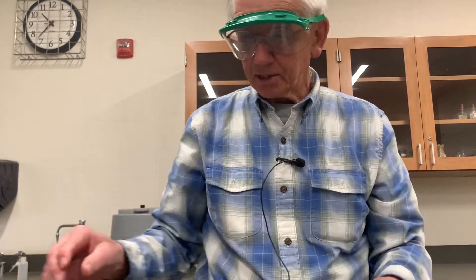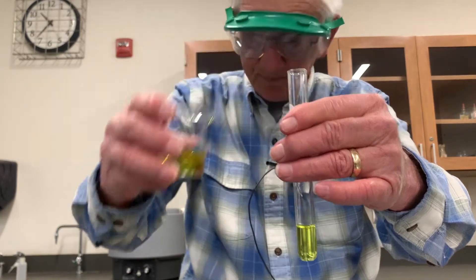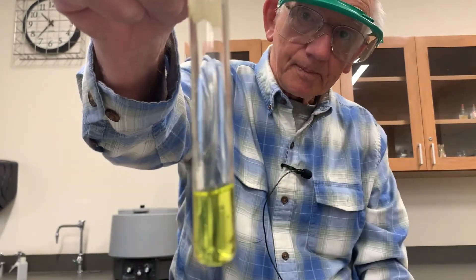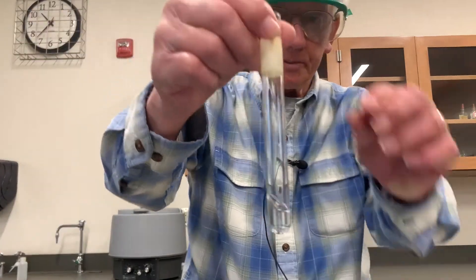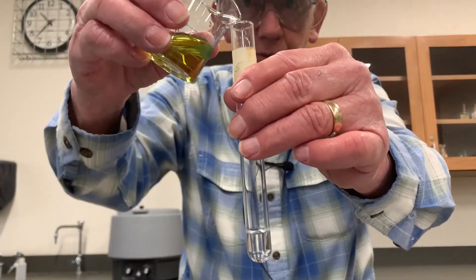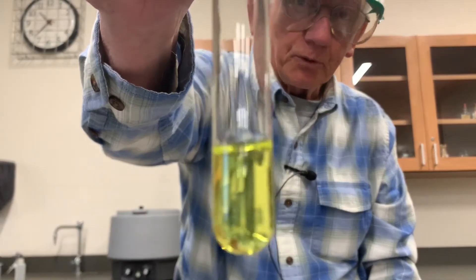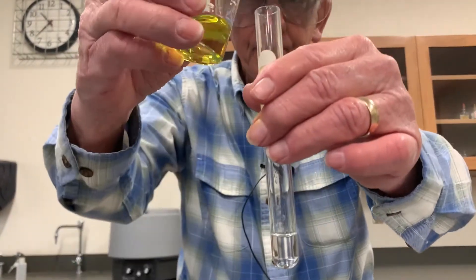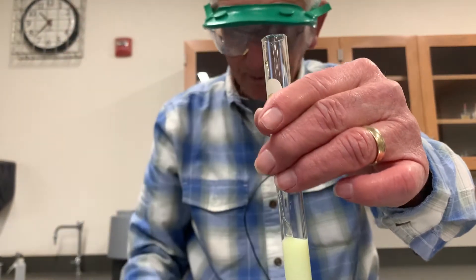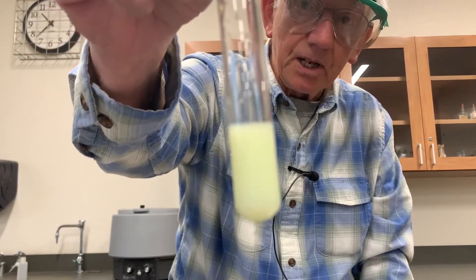So what we saw was that chromate and magnesium did nothing. Here's calcium with chromate — do they form a precipitate or not? Here's strontium. What does strontium do with chromate? Not much. There's strontium with chromate. And finally, barium with chromate.